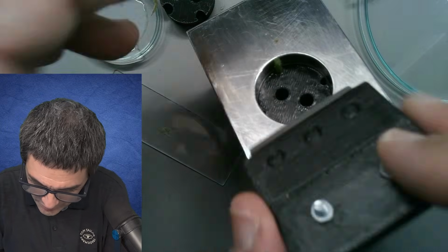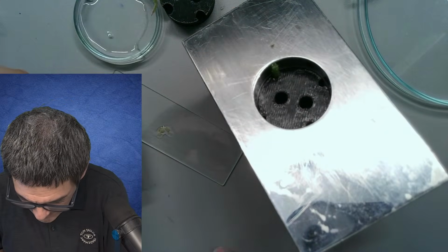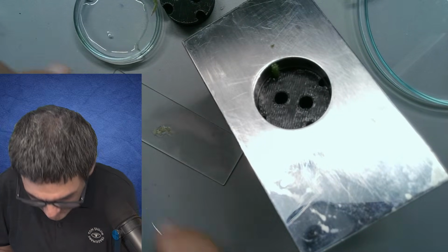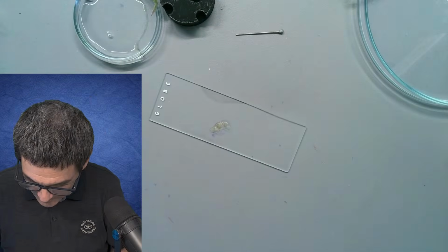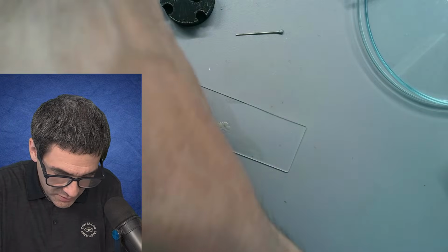And I think I'm just going to leave it then as it is. Again, in the context of a live stream like this, I cannot take the same amount of time that I normally would take. It's a little bit more like a quick demonstration of what's possible. And sometimes the quality is not the best.